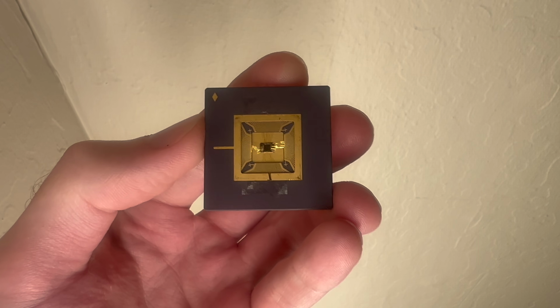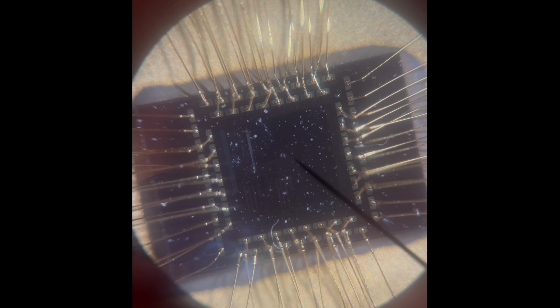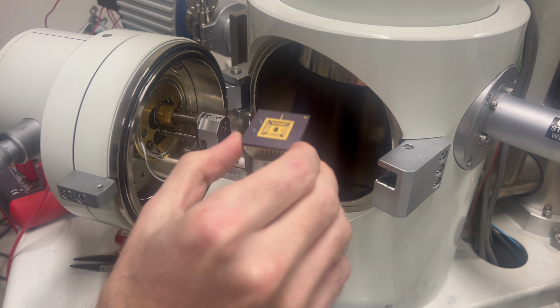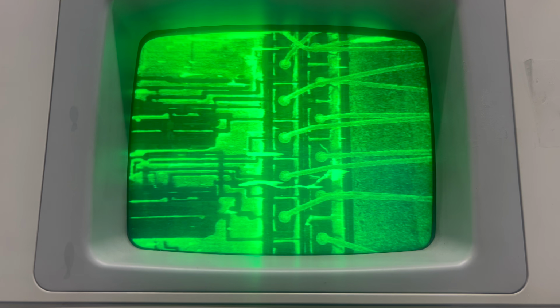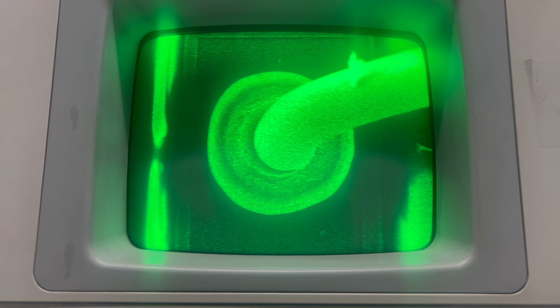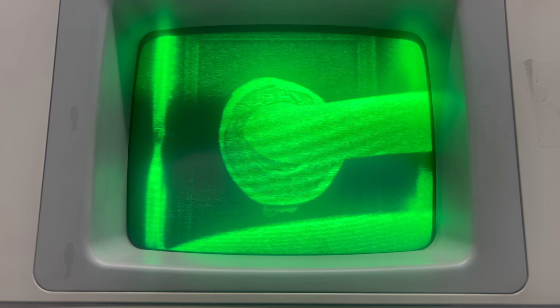I have this integrated circuit with exposed wiring, and I want to look at the wire bonds that connect the external legs of the IC to the internal silicon chip. This is accomplished with a machine called a wire bonder, which heats and vibrates a tiny gold wire and smushes it against the silicon surface, forming these mushroom-shaped pads. You can see that some of the pads are well formed, while others appear to be misshapen, but are still functional.